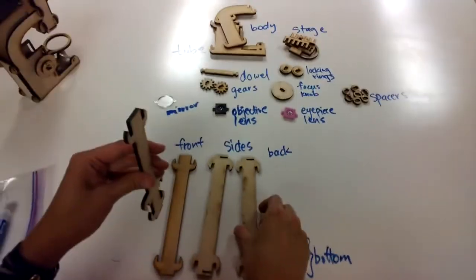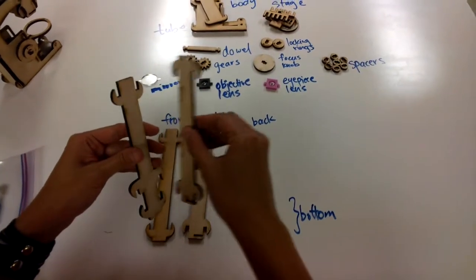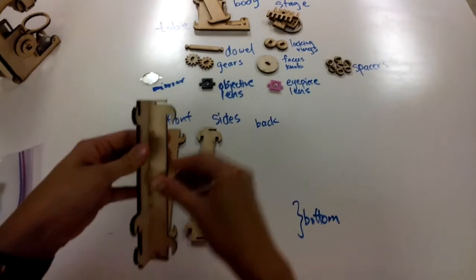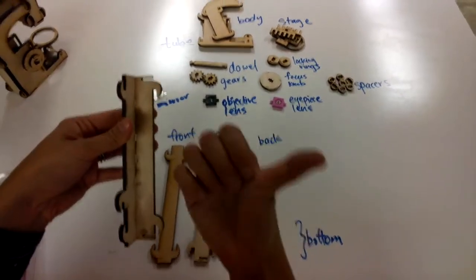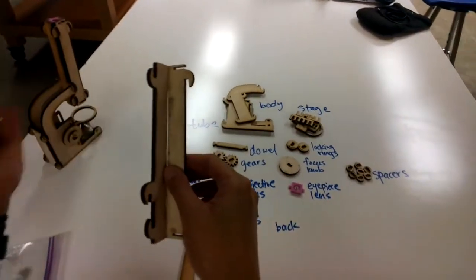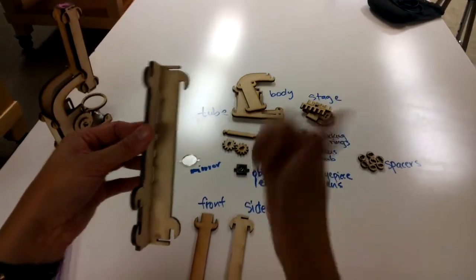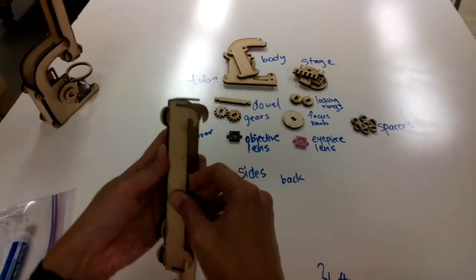So you take the back piece, and then you're going to take one of your side pieces and you're going to slot it in. So the only thing to pay attention to with this is that when you're slotting in, make sure that the open slot on the top and the bottom are pointing away from the back. So in my case, my back piece is kind of facing to the left, so I want the open end of the slot to be facing to the right. Take the other side piece and do the same thing and make sure the open side of the slot matches.